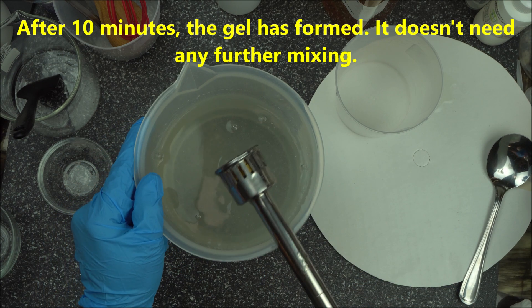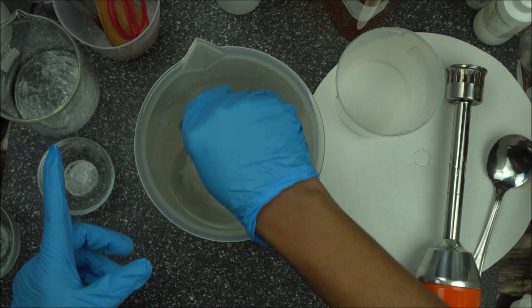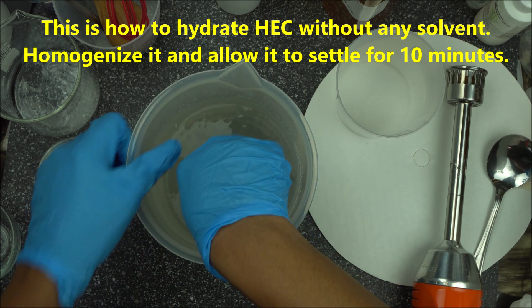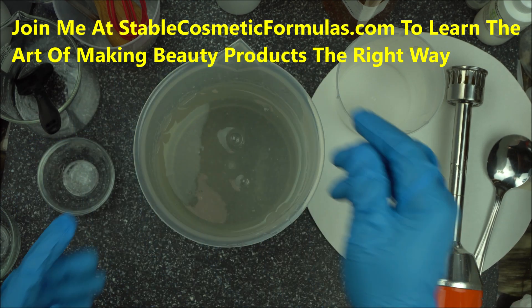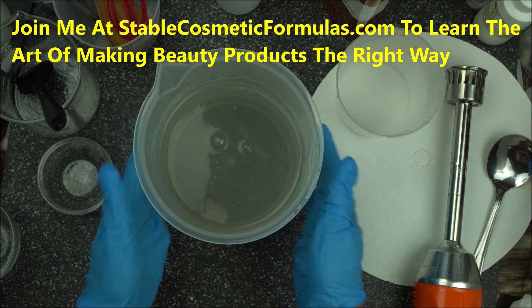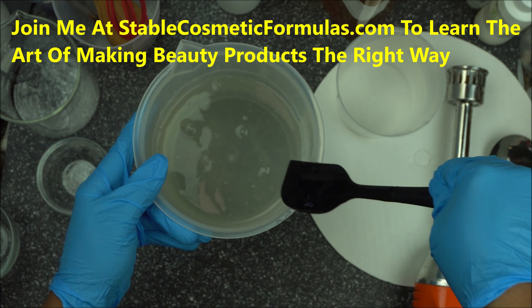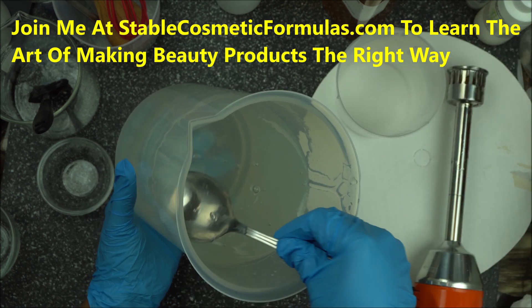So you are good to go. That is exactly how to hydrate hydroxyethyl cellulose without any form of solvent. When you look at it, it's a crystal clear gel — that is what hydroxyethyl cellulose will do for you. It's a perfect gelling agent, and when you use a handheld homogenizer you get a smoother, more refined gel. This is exactly what I recommend for you. Look at how smooth it is — it looks like water but it's actually a thick gel.